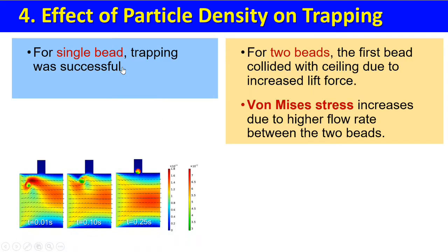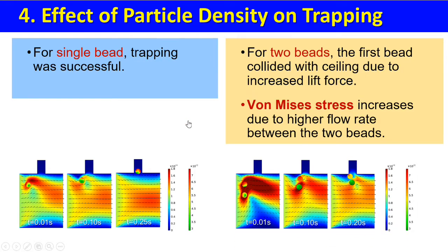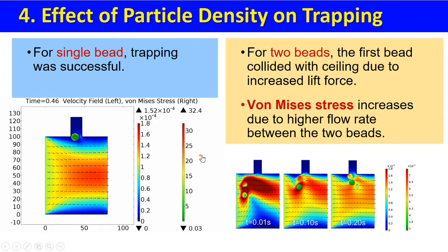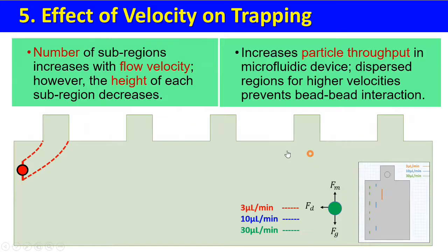4. Effect of particle density on trapping. For a single bead, trapping was successful. For two beads, the first bead collided with the ceiling due to increased lift force. Von Mises stress increases due to higher flow rate between the two beads.